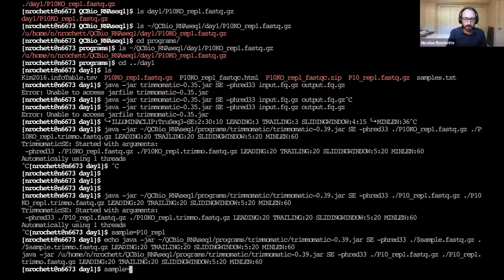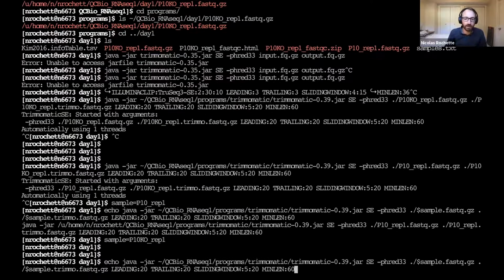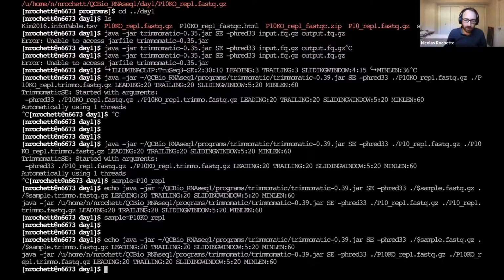And I do have the same command in both cases. And the good thing is, if now I'm changing the sample I'm working on, so instead of p10 rep 1, like here, I was saying I'm working on sample p10 rep 1, and I'm storing this as the value of the sample variable. And I can change this, and if I look at my command again, now it's changed, and it's changed in both places. And that's why having a single variable definition where I'm writing the sample in a single place is really helping avoid these human errors.